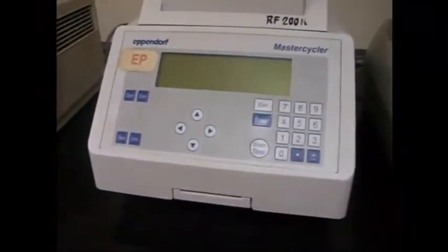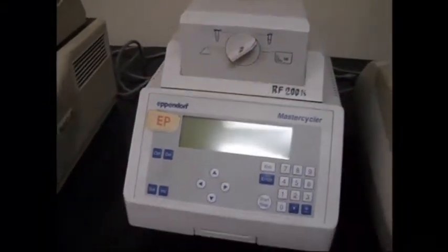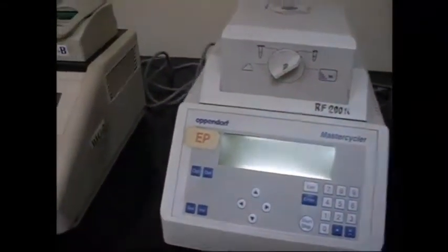The PCR is a biochemical technology in molecular biology to amplify single or few copies or pieces of DNA, generating thousands to millions of copies of a particular DNA sequence. Developed in 1983 by Kary Mullis, it is a common and indispensable technique. These are the various PCR machines in our lab.